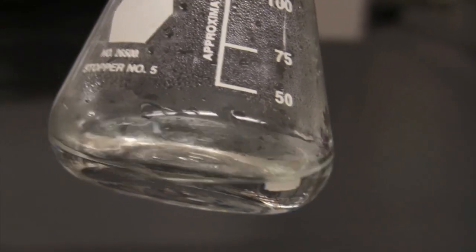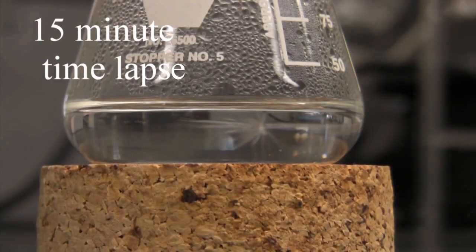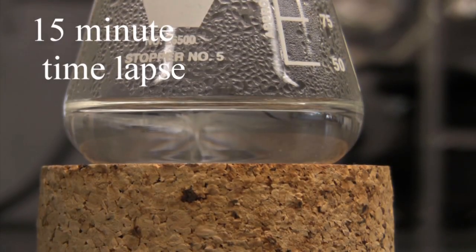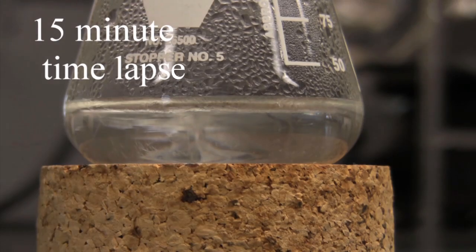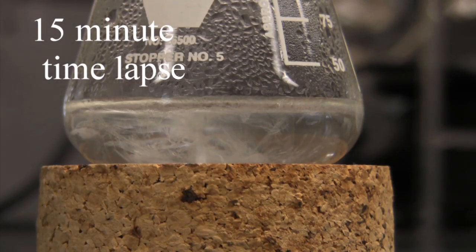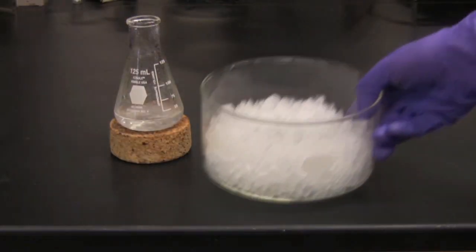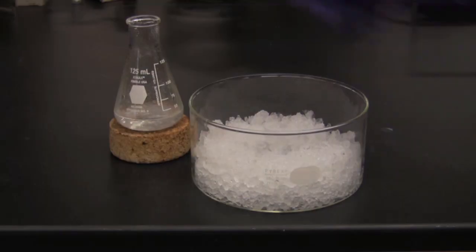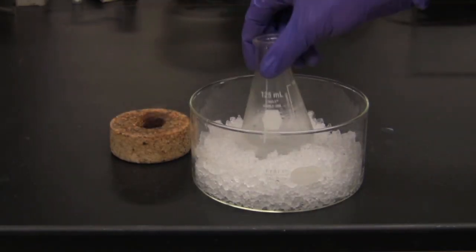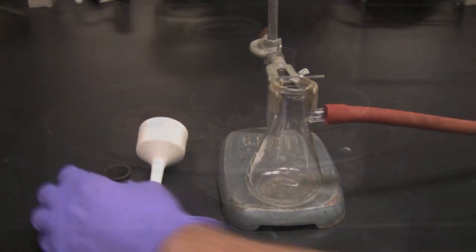The solution is allowed to slowly cool to room temperature. Slow cooling is important to allow for formation of the largest possible crystals, and thus the most pure solid. Once the solution has reached room temperature, an ice bath can be used to promote further recrystallization.